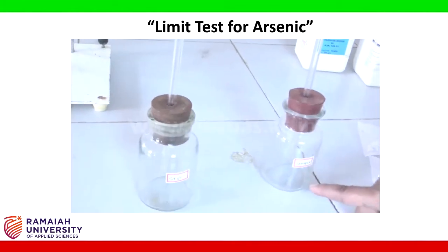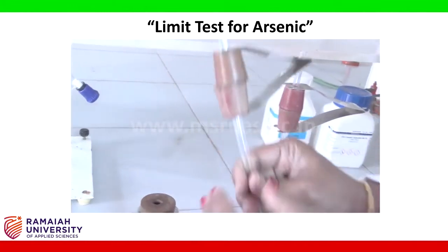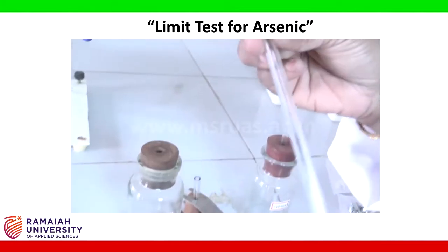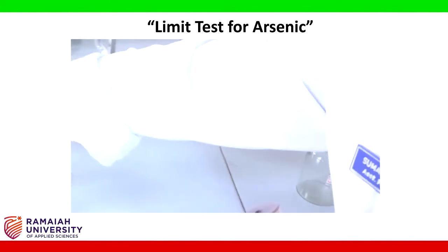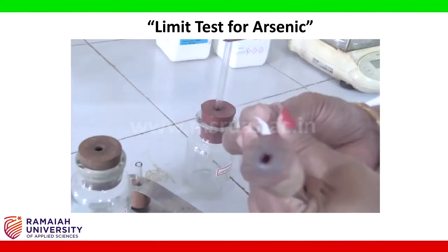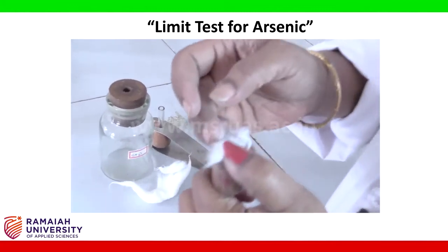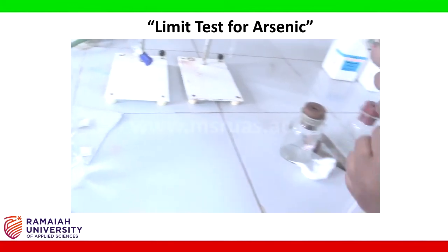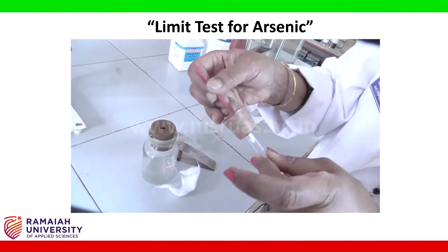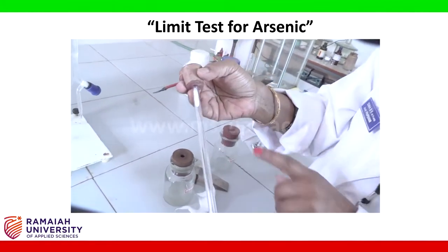Now we will assemble the apparatus. First, we have to insert the lead acetate cotton wool in the capillary tube. Take a small bit of lead acetate cotton wool, pack it loosely this way in the capillary tube.